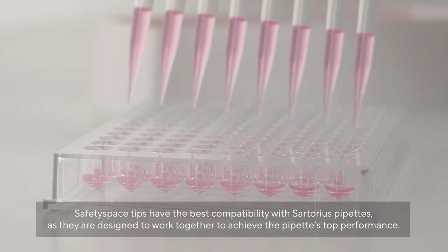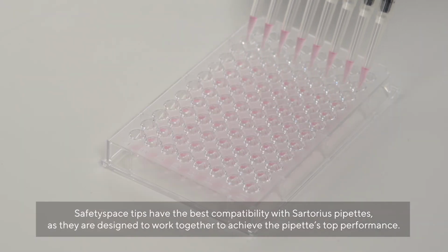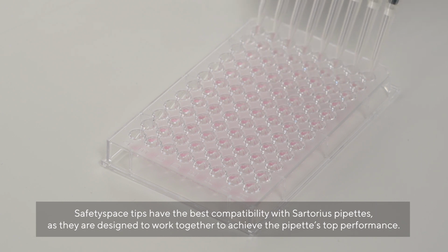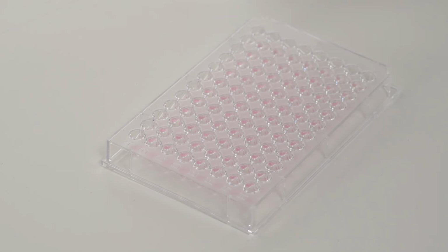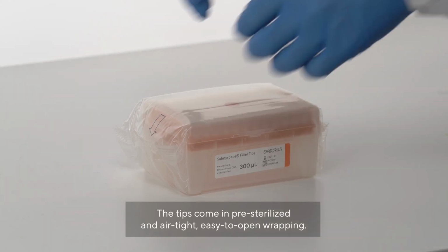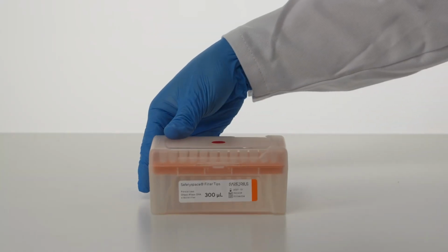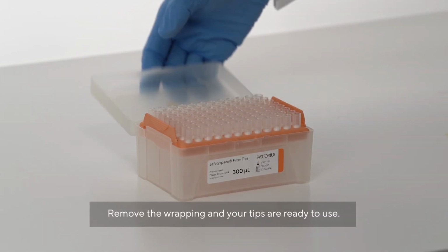Safety Space Tips have the best compatibility with Sartorius Pipettes as they are designed to work together to achieve the pipette's top performance. The tips come in pre-sterilized and airtight, easy to open wrapping. Remove the wrapping and your tips are ready to use.